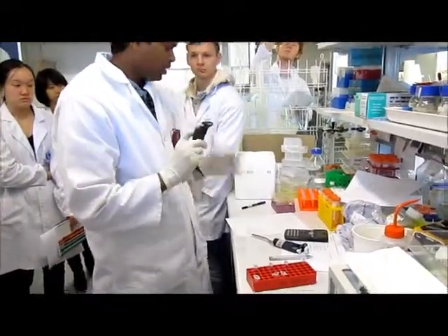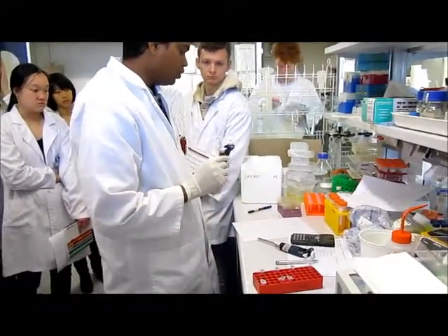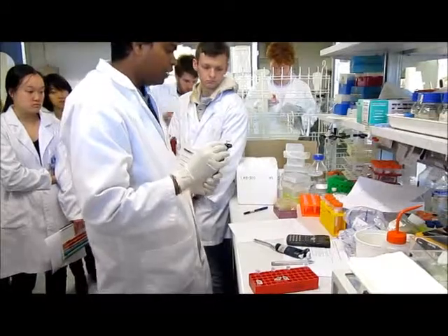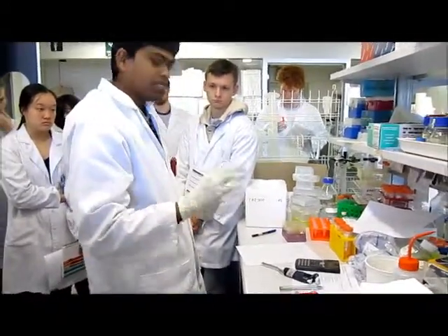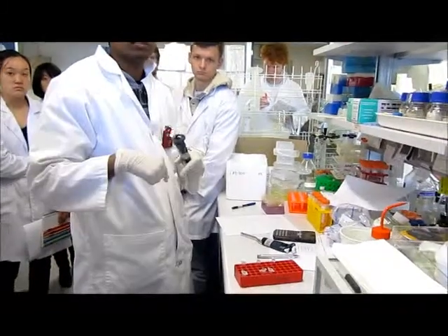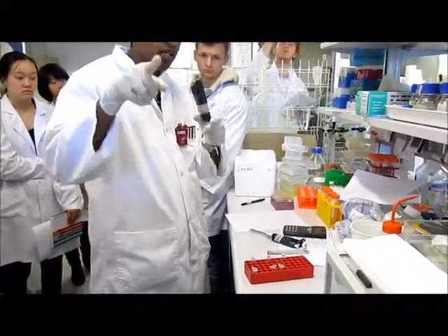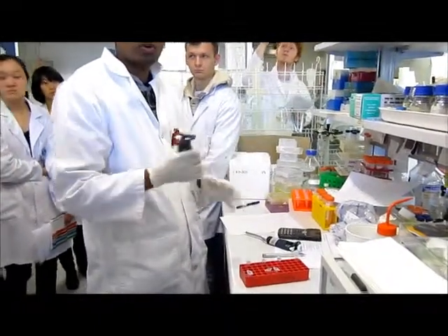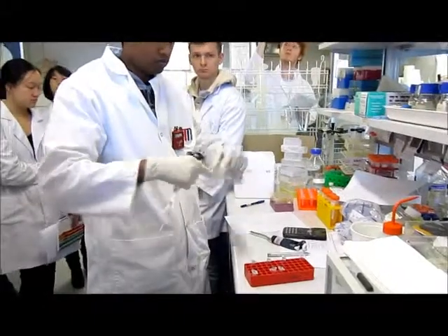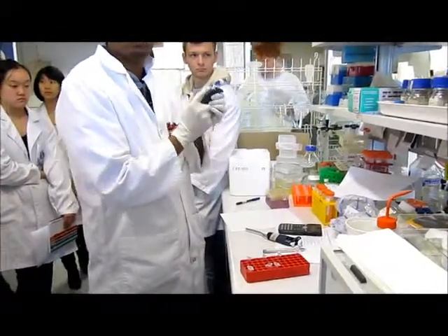But I took 50 microliter because then hopefully I will have enough of vector digested that I'll be able to see on the gel. I need to run the gel after the digestion, and then I'll be able to see in the agarose gel hopefully 2 separate bands for your parent vectors and 1 thick band for our expression vector.